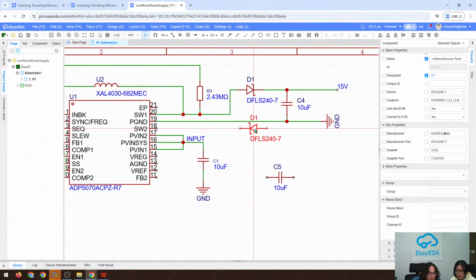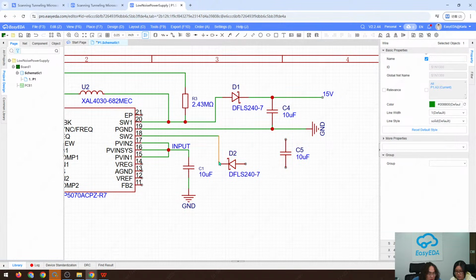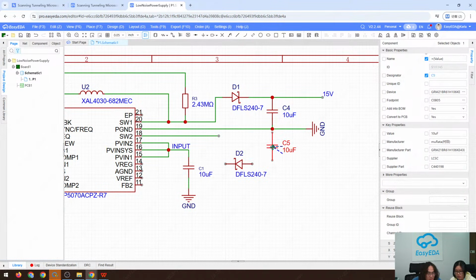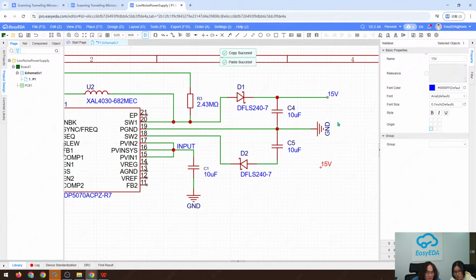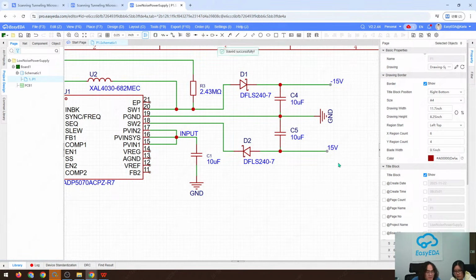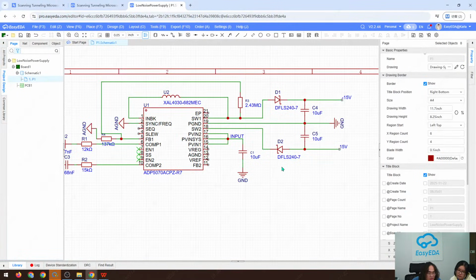SW2, and you can notice the difference for the negative voltage. The diode is reversed. This is the negative. Okay. So again, we need to set the resistors. 118. 118.